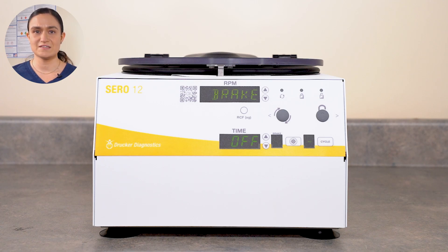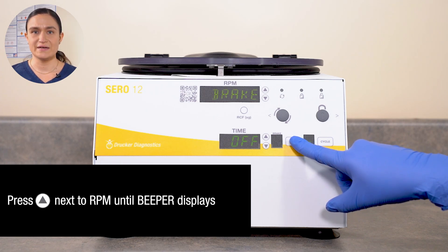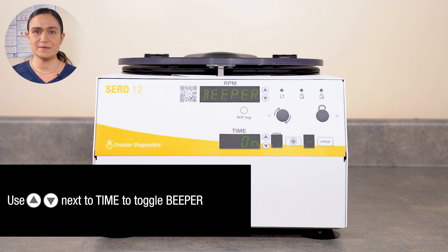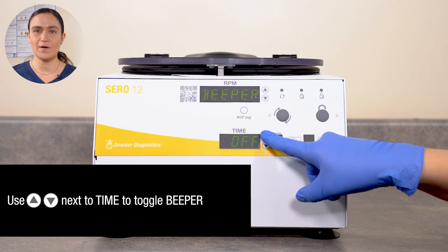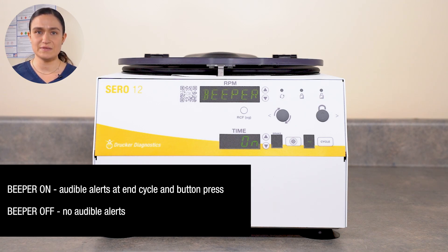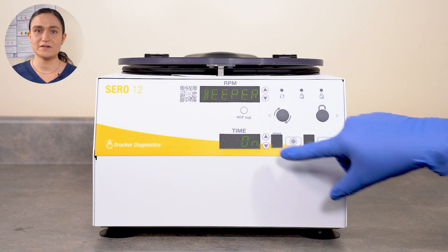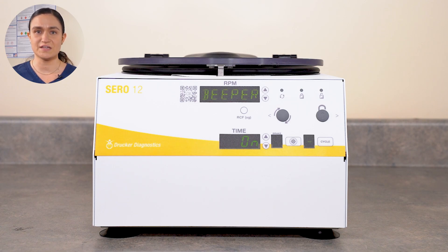Once your brake value is set as desired, press the menu button to exit the menu, or press the up arrow button to access the next setting adjustment. Our next option is beeper, which controls the audible alerts. Beeper is a toggle — audible alerts can either be turned off or turned on. If it is on, the centrifuge will beep at the end of a cycle and beep when buttons are being pressed. If it is off, the centrifuge will not have any audible alerts at all. Beeper is a universal setting — audible alerts are either on or off in free mode and for all saved cycles.